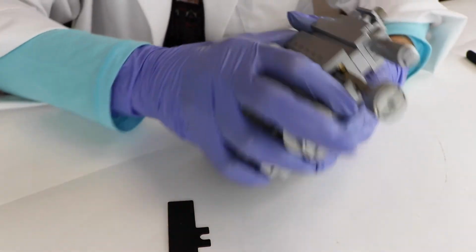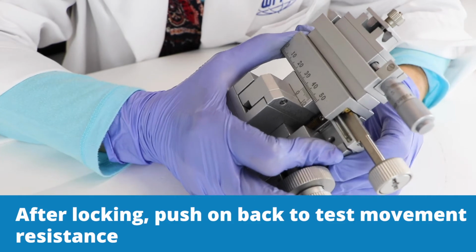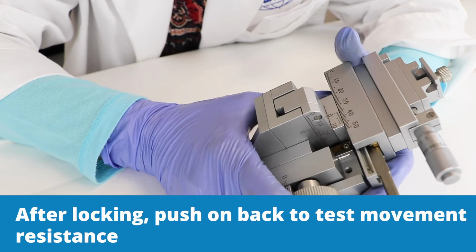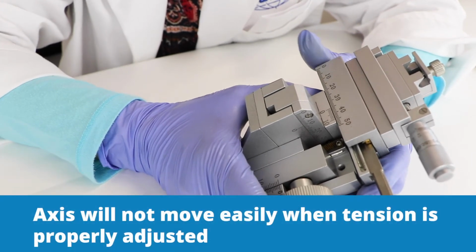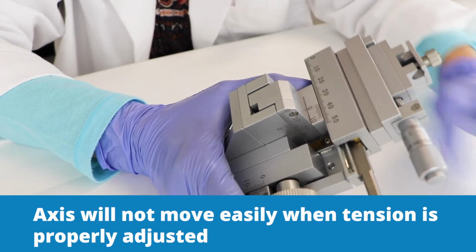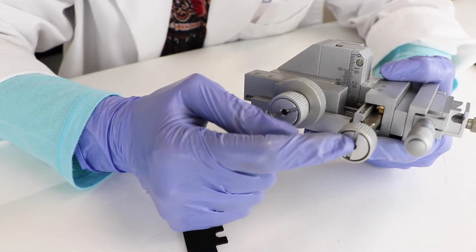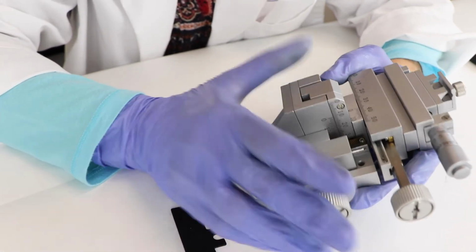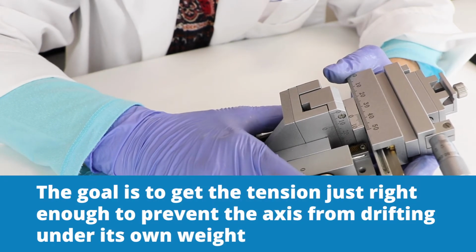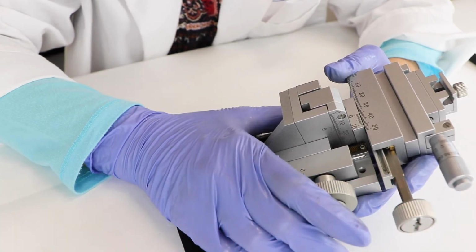Once you've got it there, then you want to push on it here and test the movement. Test the drift resistance of the axis by pushing against it with your hand and see how easily it moves. When the tension is adjusted correctly, it will not be easy to move the axis when you're pushing it. If the action feels too tight or too loose, then you go back and unscrew it again and do it again. It may be necessary to repeat the procedure a couple times. Typically, the goal is to get the tension just right, enough to prevent the axis from drifting under its own weight, but not any tighter than necessary to achieve this end.